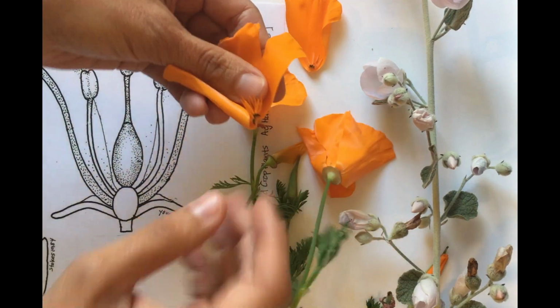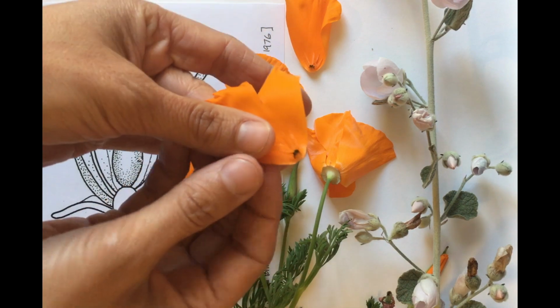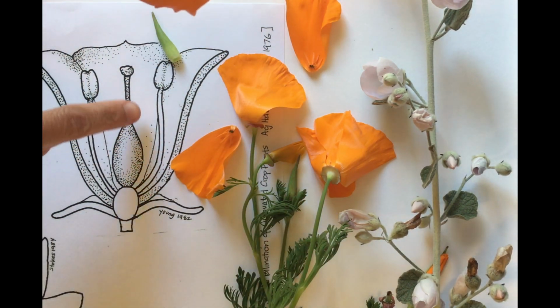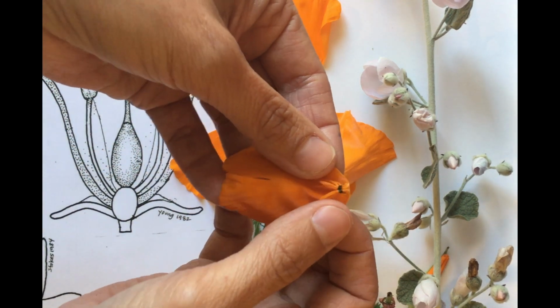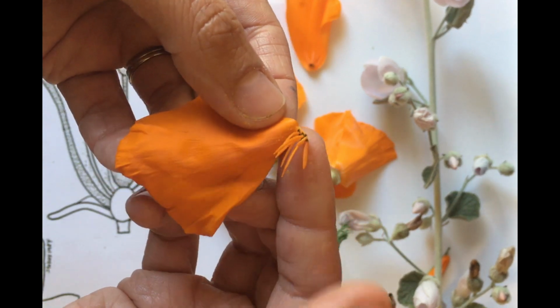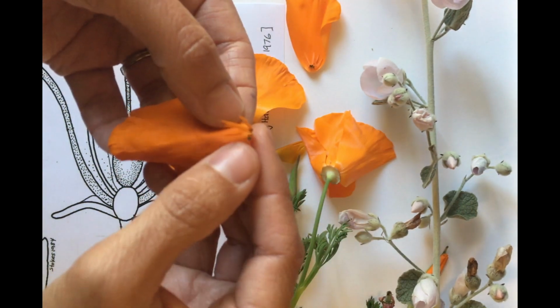Inside the petals are the stamen, or the male part of the flower, where the powdery pollen is produced. This poppy is a little bit different than the diagram, which shows an anther attached to the filament. Before moving on to the next part of the flower, let's think about how a small grain of pollen gets to where it needs to go. If you're thinking of a pollinator, then you're right.